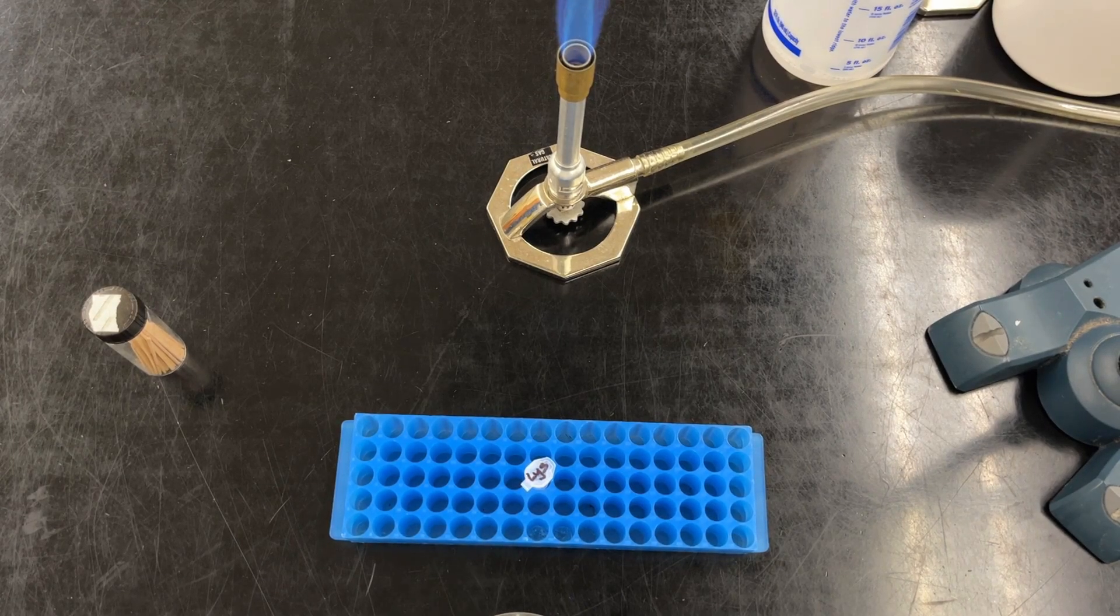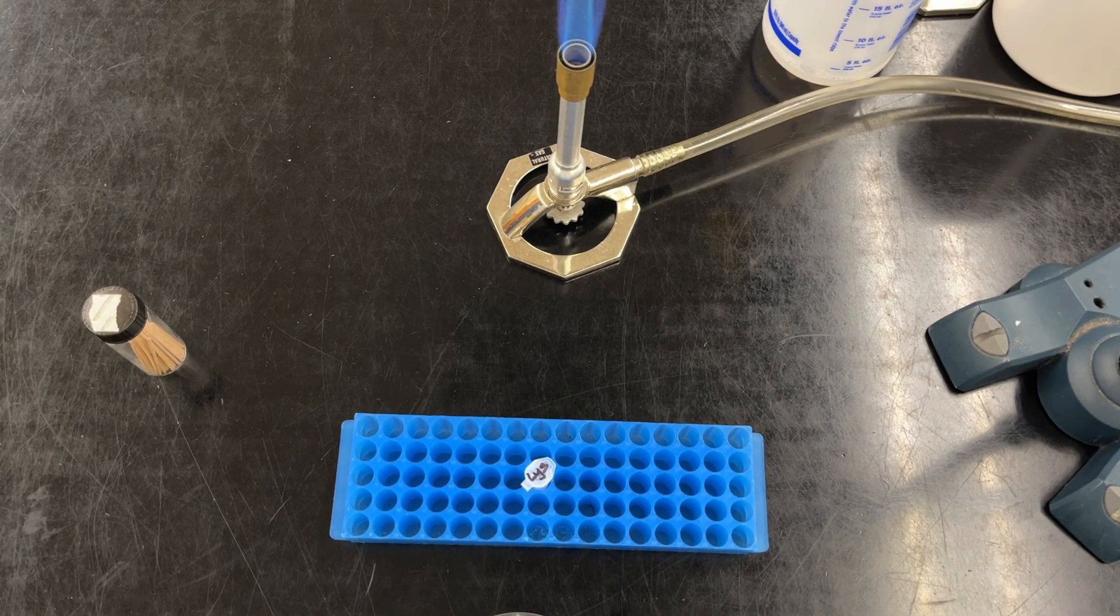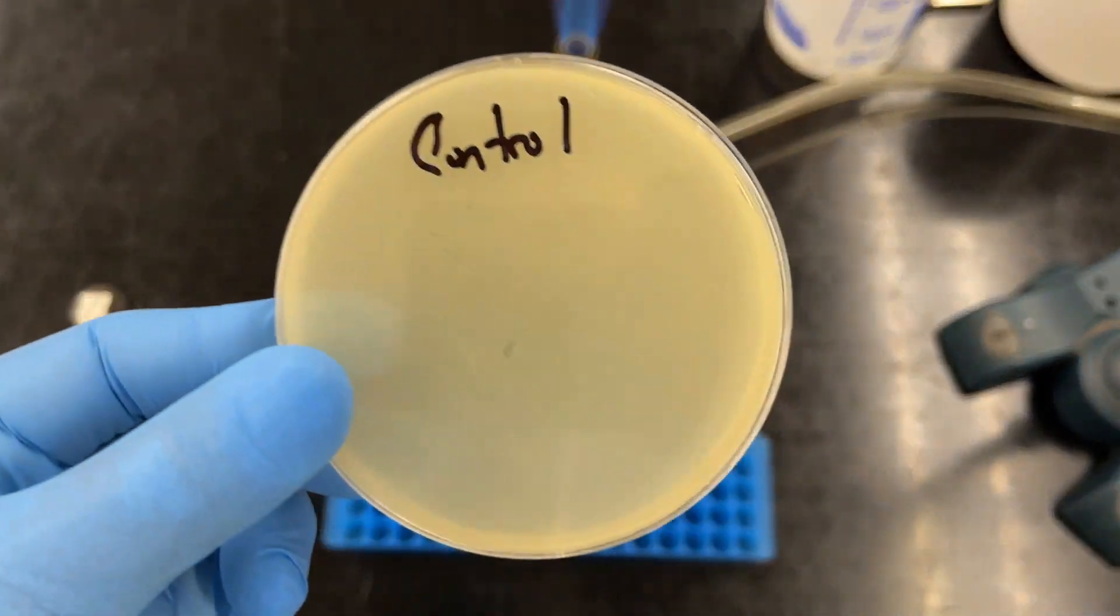When growing bacteriophages or viruses that infect bacteria, you need to give the phage something to grow on, and in this case it's bacteria.